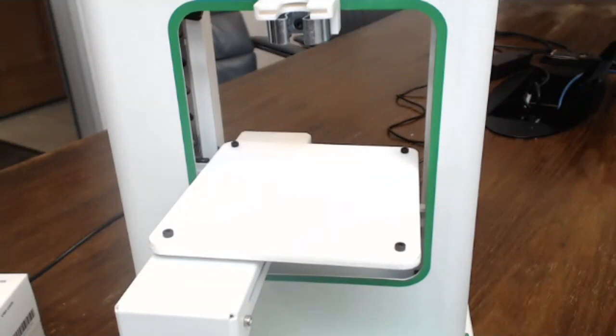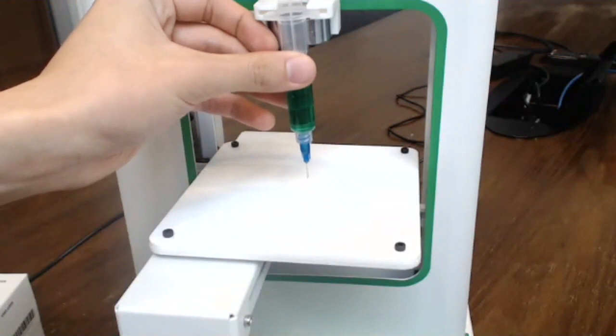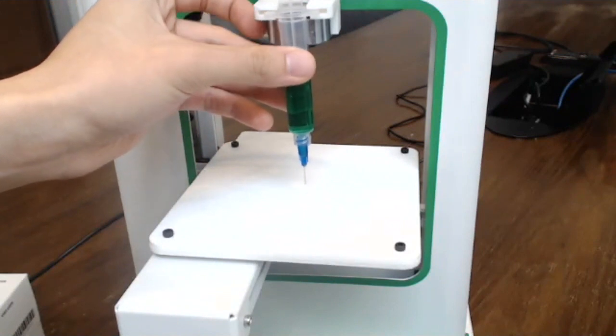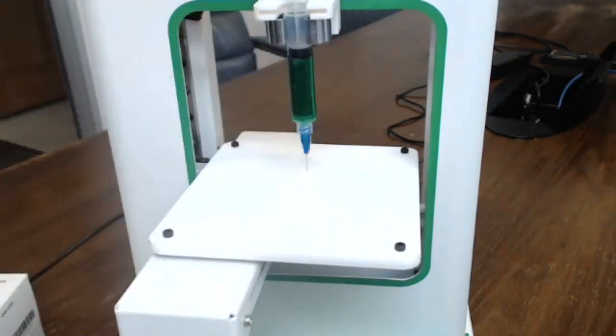So Oliver is going to load the G-code file that he just outputted onto Pronterface. And now he's going to load the syringe. Here we have pluronic material, which is in green, and we're now using the 22 gauge needle. We have a print that we did on the 14 gauge, which we'll show you later on as a comparison to see what the difference looks like.